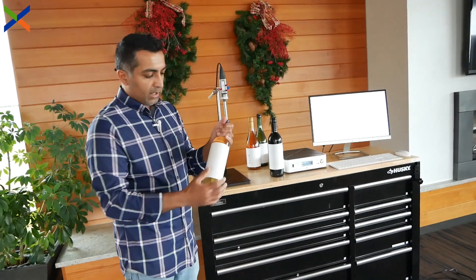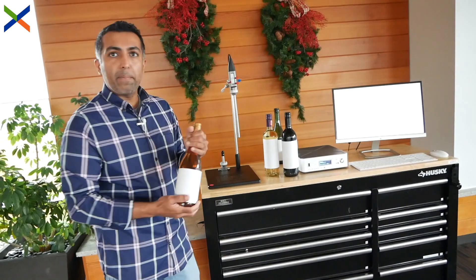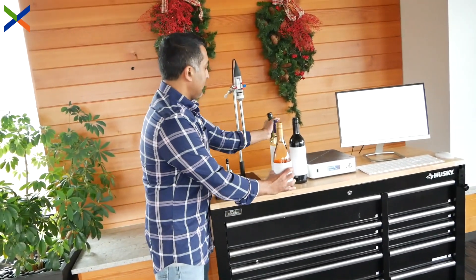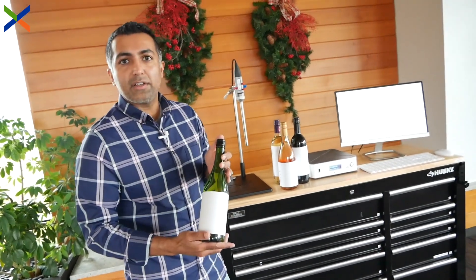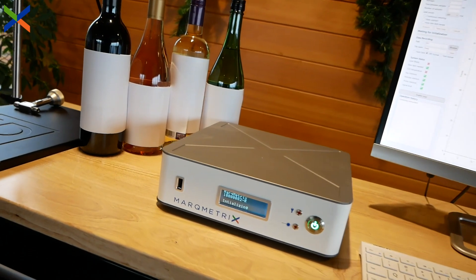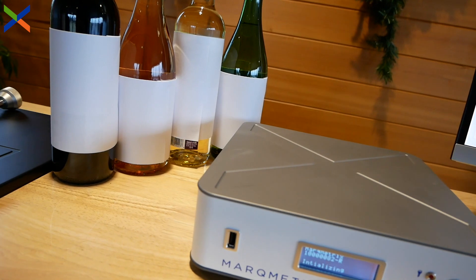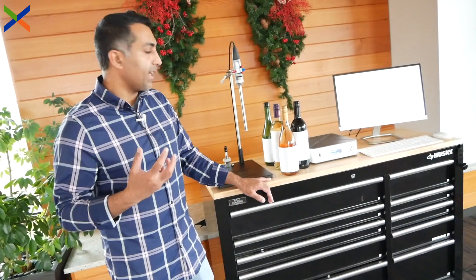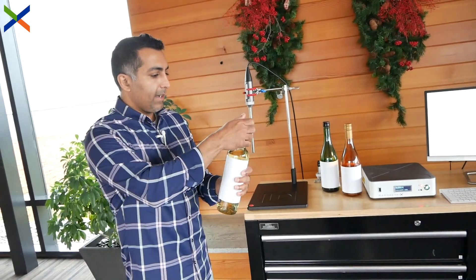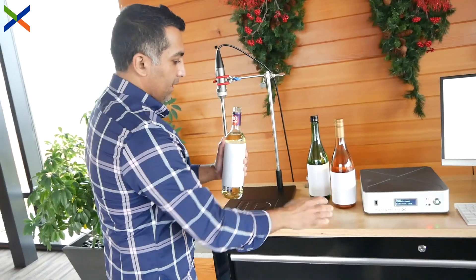We have a white Riesling, we have a pink rosé, and we have another white wine — sake, made from rice wine. We're going to use Raman spectroscopy to measure the differences between these wines, and even between the whites, based on the amount of sugar and the amount of alcohol. Let's crack open a bottle of Riesling.